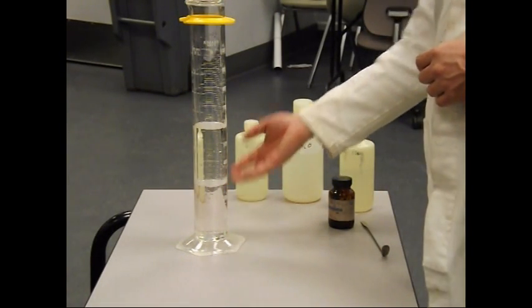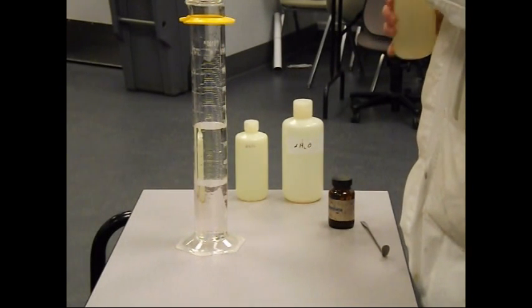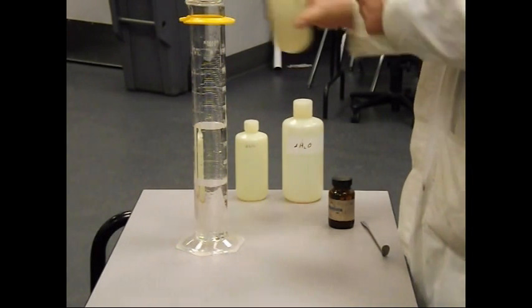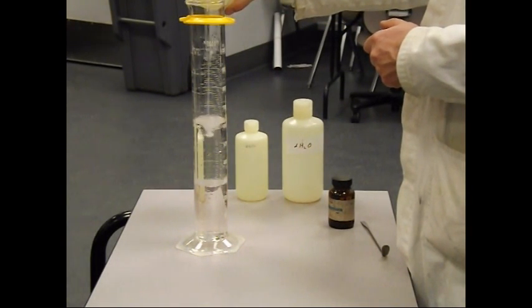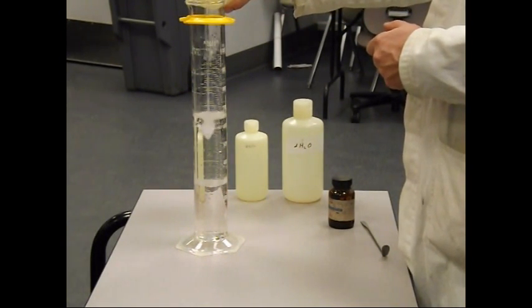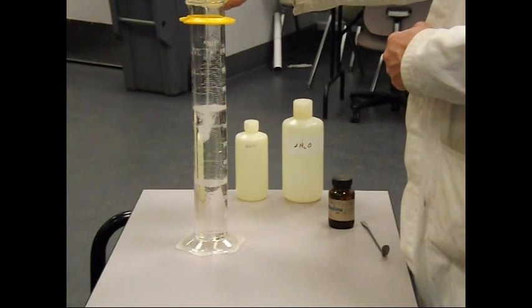Dichloromethane is more dense than water. And the last thing we're going to add is hexanes. So this is just like gasoline, components thereof, organic liquid.